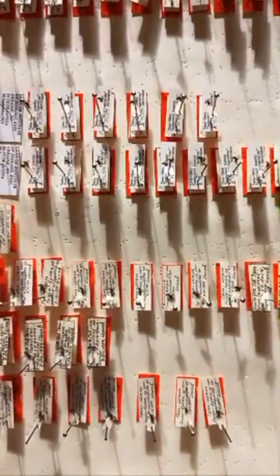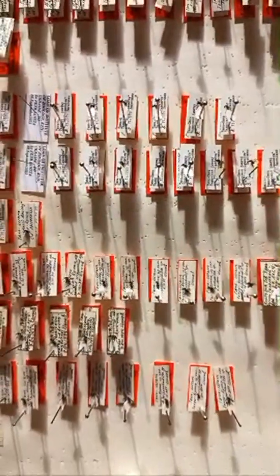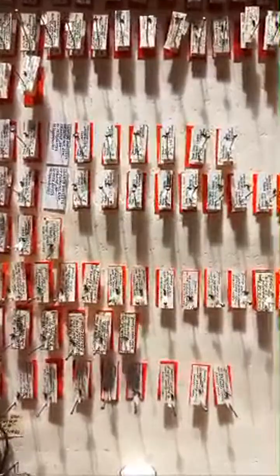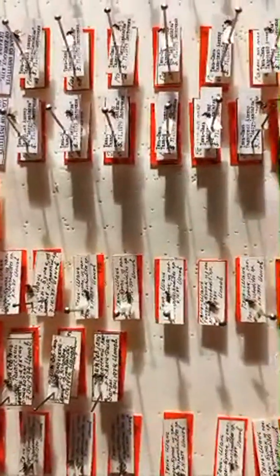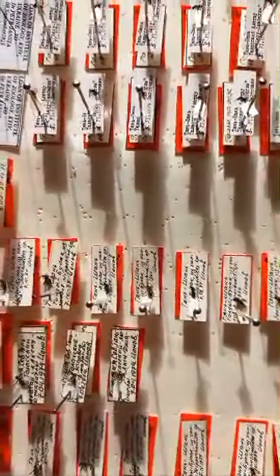You can write in chat or in comments. Do you have insect collections? Do you have type material in your institute, in your university, in your museum? I am very pleased to show you this material, which is stored in Kyiv, Ukraine, in the Institute of Zoology of the National Academy of Sciences, Kyiv, Ukraine.